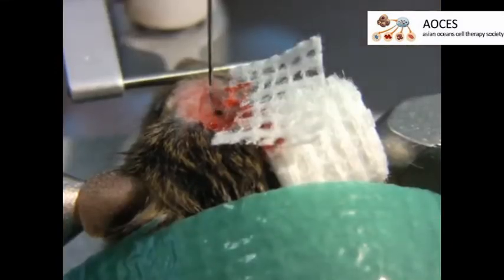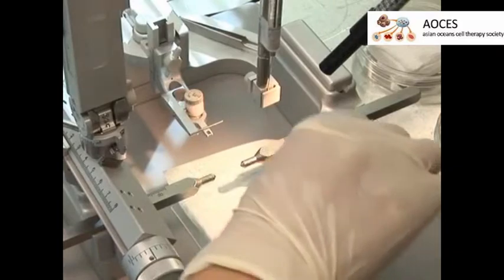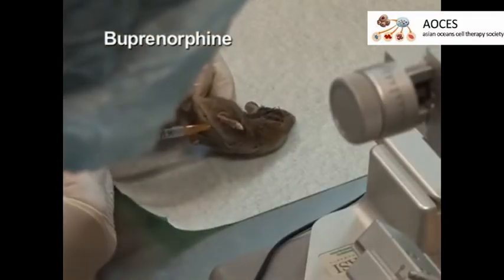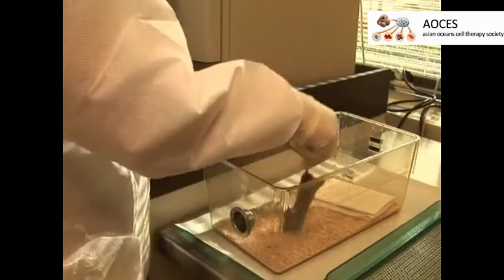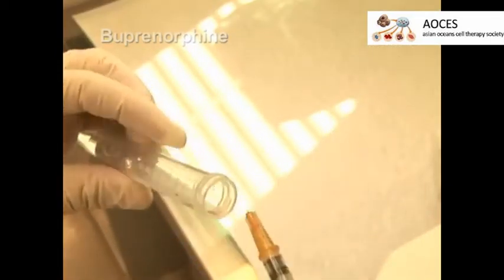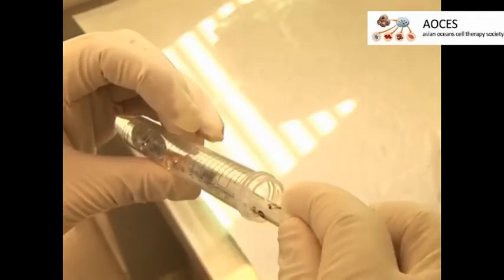Next, carefully withdraw the needle and close the incision site with sutures. Then, release the mouse from the stereotactic apparatus. Administer a subcutaneous injection of buprenorphine for analgesia. Move the mouse to a warm, dry area and monitor the animal until it is able to maintain an upright posture, then return it to the home cage. For the first three days after the labelling procedure, systemic analgesics and topical antibiotic ointment are given twice daily and the mouse is closely monitored.